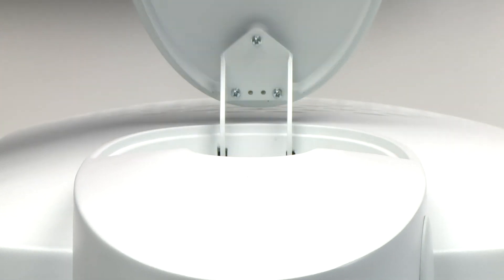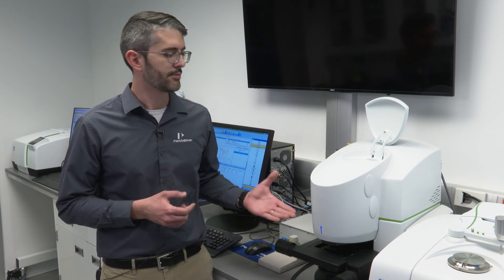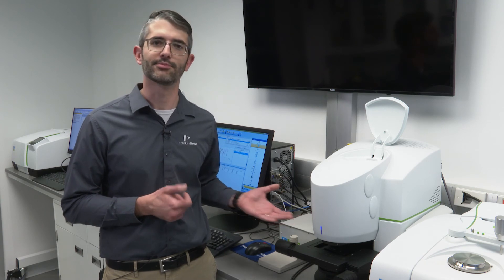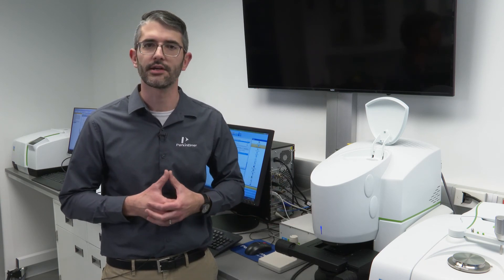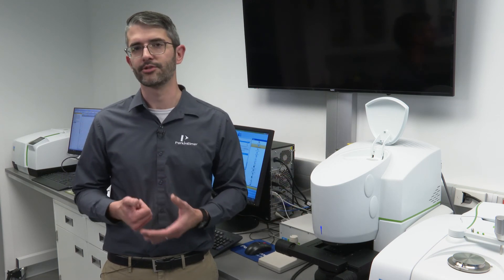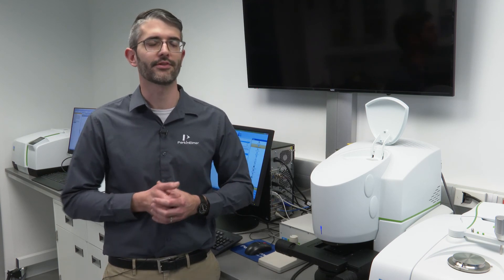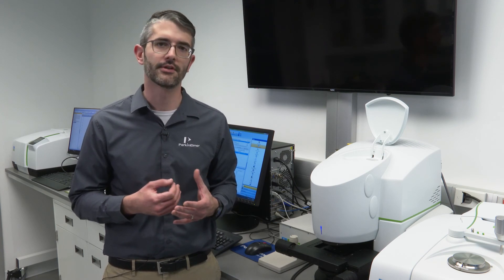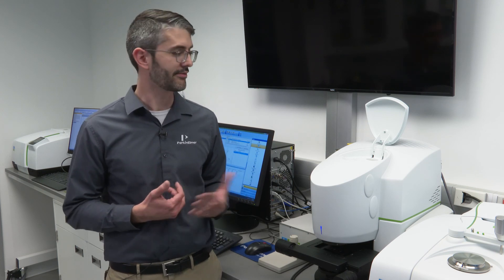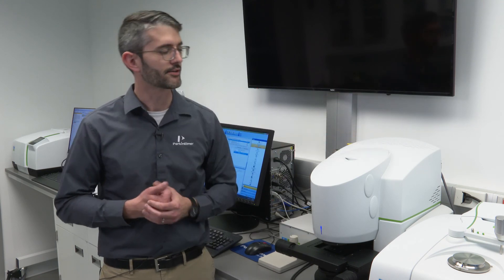These infrared microscopes will often employ what is referred to as an MCT detector. The infrared beam is focused to perform measurements of that sample and that region of interest. If that region of interest is extremely small, apertures are employed to restrict the infrared beam which travels through the sample to the detector. Because apertures are employed, only a small amount of light is actually able to reach the detector. The MCT detector is required for its high sensitivity — it can work with very small amounts of light, which makes it extremely helpful in microscopic measurements.